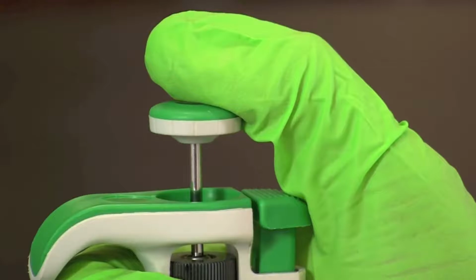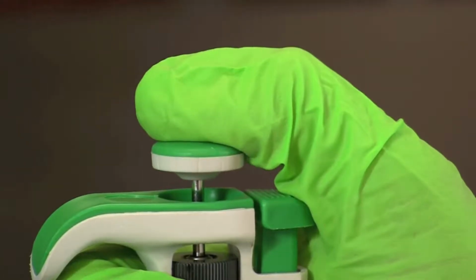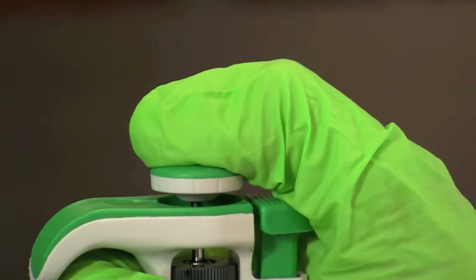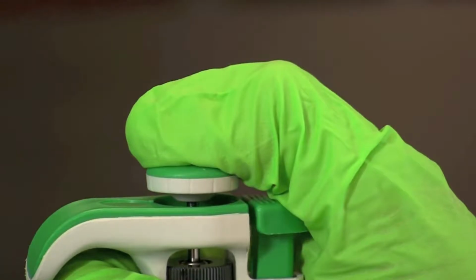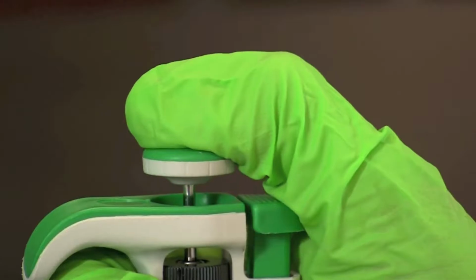The plunger has two stops. Press slowly to the first or soft stop. The soft stop is the calibrated measurement. If you continue pressing from there, you will reach a second or hard stop. The hard stop is only used to aid in dispensing liquid completely out of the tip by providing a little burst of air.